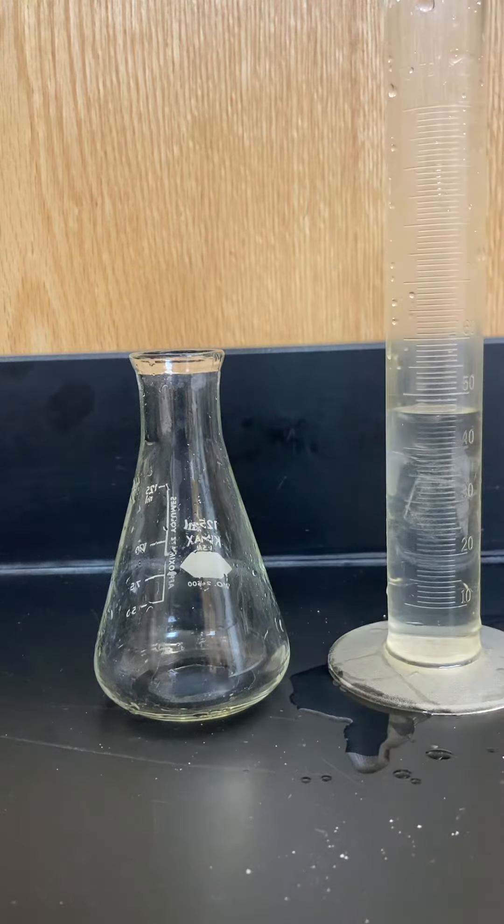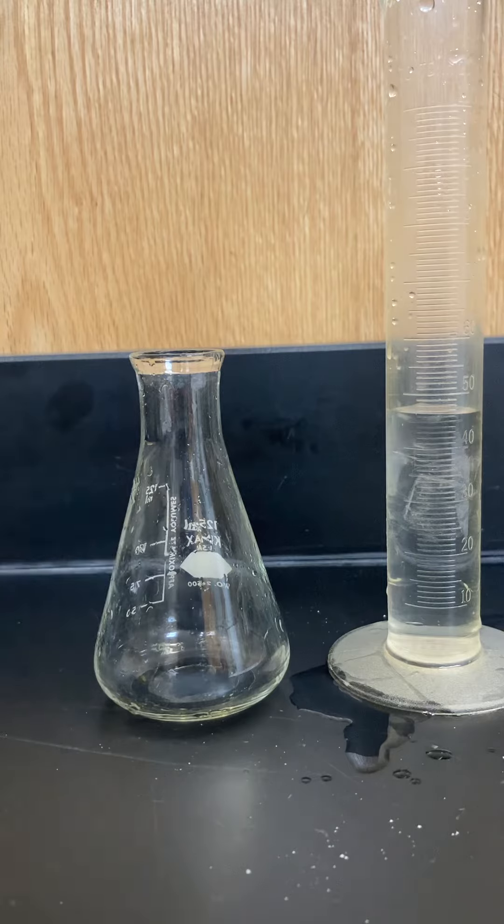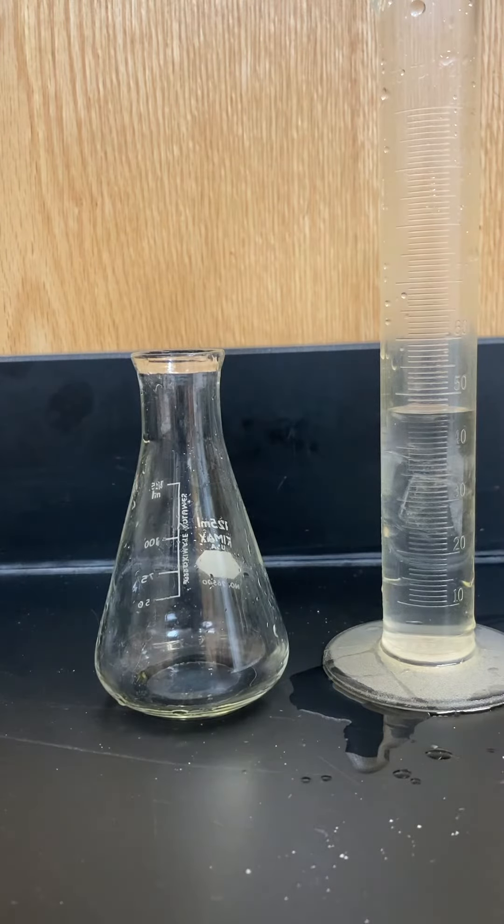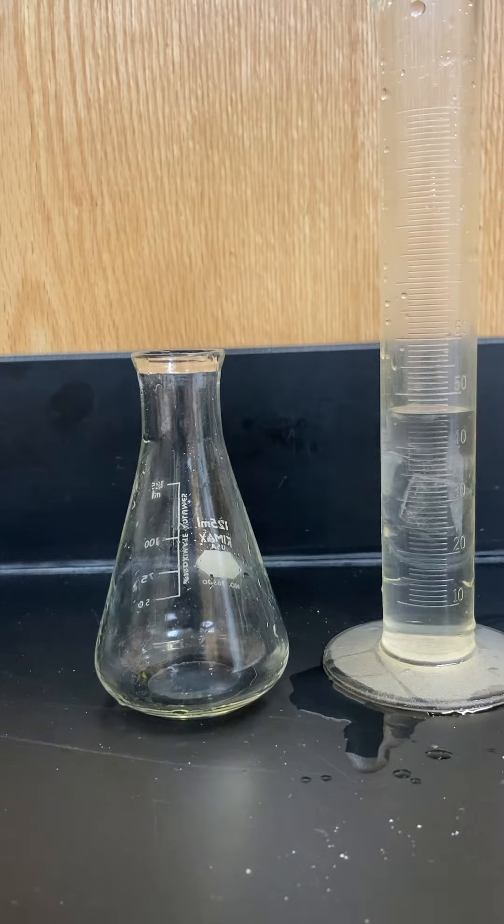Okay, in this next trial I have 50 milliliters of water and I have half a tablet again, like one big tablet, one big half. Except I'm using cold water this time and I just put a bunch of ice cubes in. We're going to do this qualitatively as far as the independent variable, so I just cooled it down quite a bit.